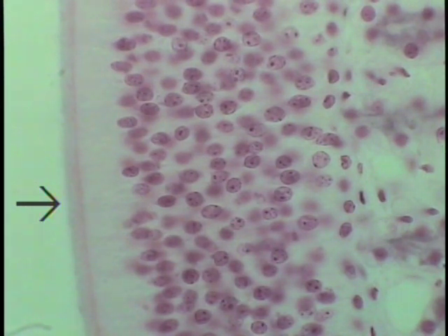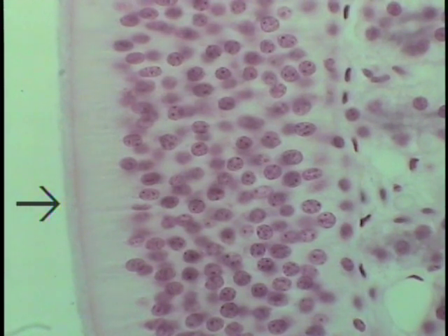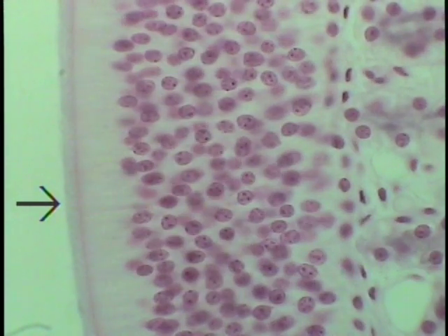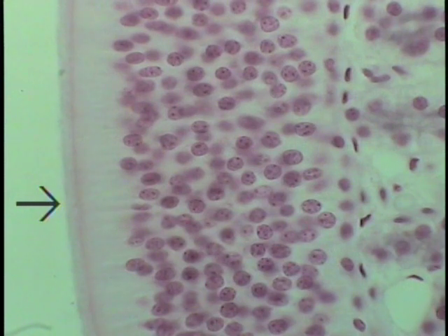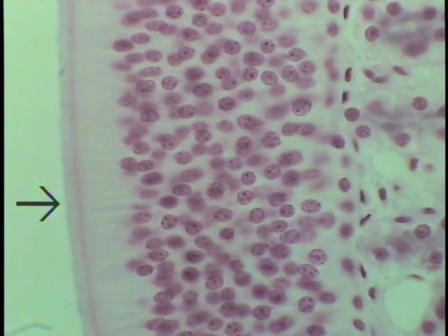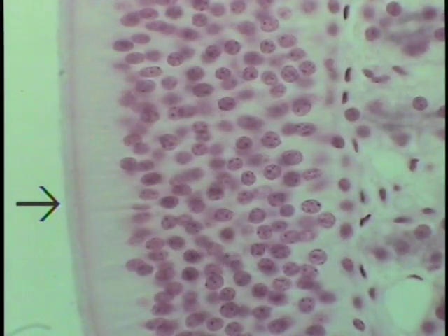Just a very brief clip or shot of the olfactory epithelium taken at extremely high magnification. The arrow indicates the position of the cilia, but please do remember these are lying horizontal to the surface and don't stand up as do the typical motile respiratory type cilia. So this is the high-powered view of the olfactory epithelium.